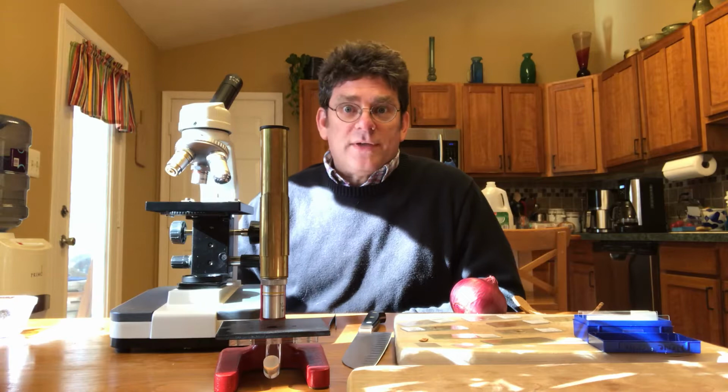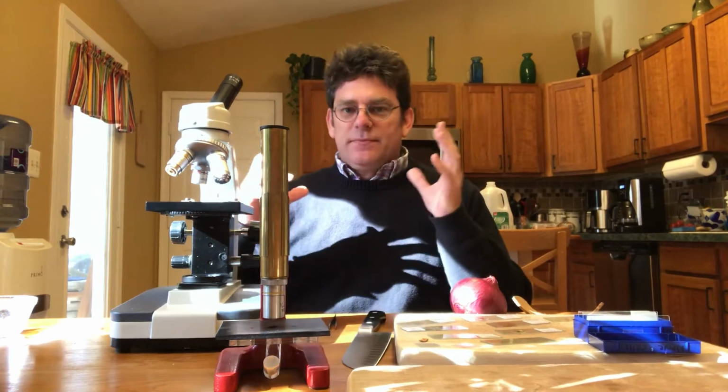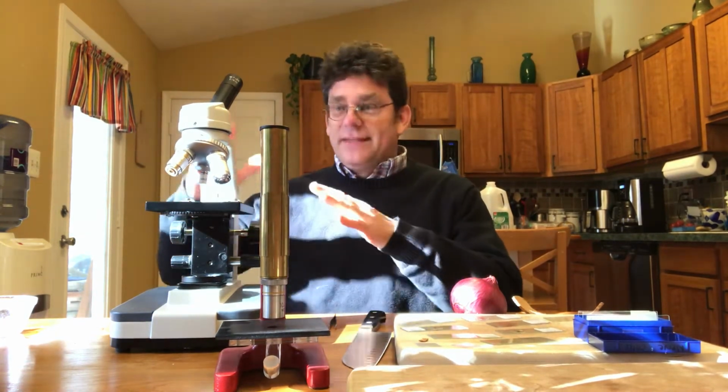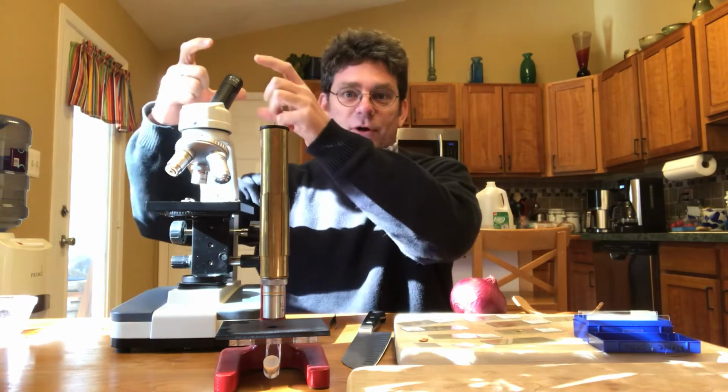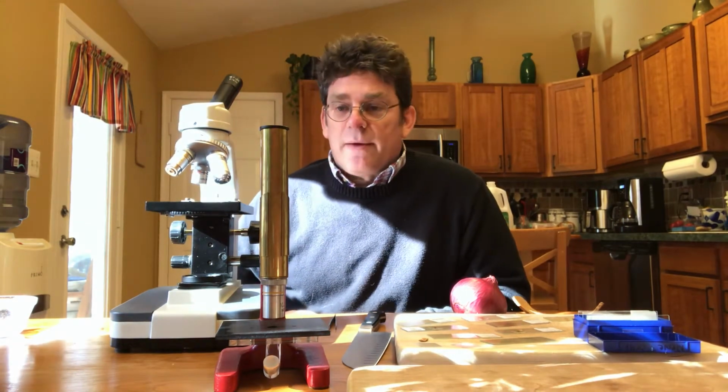So I just want to go over a quick tutorial, a little bit about our microscopes and how they work, and then try to look at a few slides. And then what I'll try to do is, once I'm done videoing, I'll try to get things focused and use my phone. A lot of times if you put a phone or a camera on top of the lens, you can get a pretty good picture of what you're supposed to see. So I'll try to show you that real quickly.